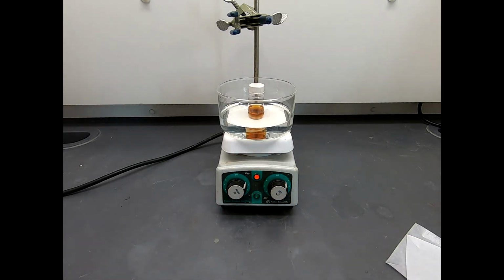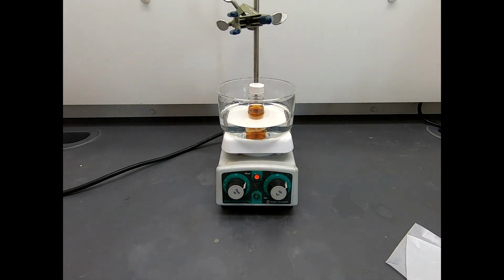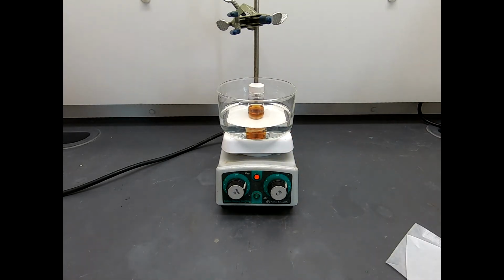All I want to do is warm up this methanol a little bit, and 1 on this water bath is plenty adequate, and a 1 on this hot plate is not going to get our hot plate too hot, so it's not going to cause a problem. Sometimes people get impatient, like, I want it hot right now, so I'll just crank it up to 10 for a few minutes, and then I'll knock it back down to where I want. And that's when you start to run into problems. So let things warm up slowly. I know it's hard to be patient, but it's a better approach than cleaning up a mess later.